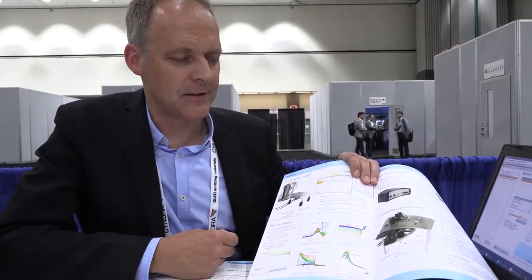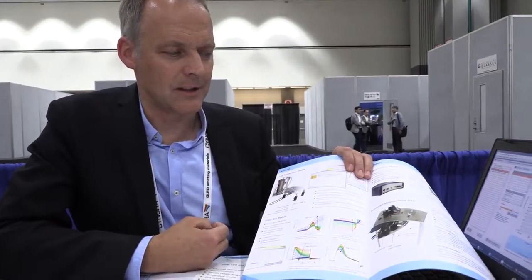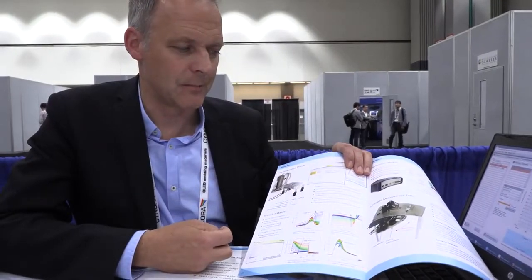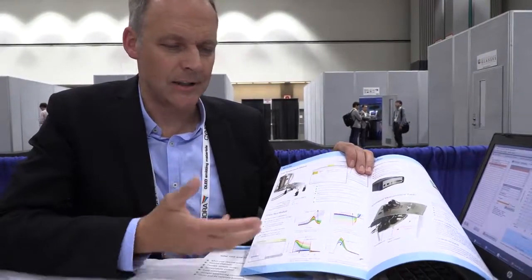And so that was with the blue, or some other things in OLED that are degrading? Yes, exactly. Blue is still a challenge for OLED displays. The blue is not as stable as green and red, and there is a lot of chemical synthesis effort going on to improve the material that emits blue light, and our research tools help in this challenge.